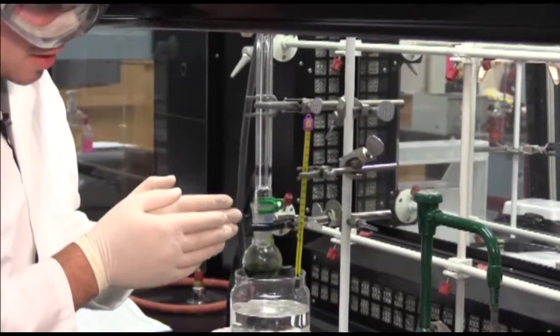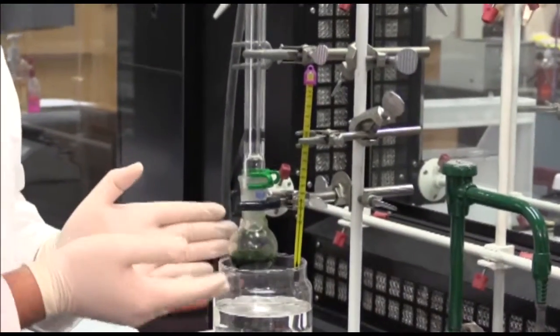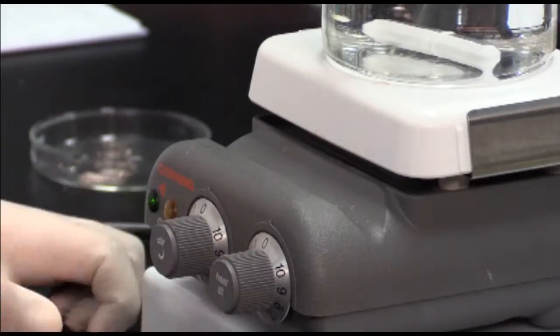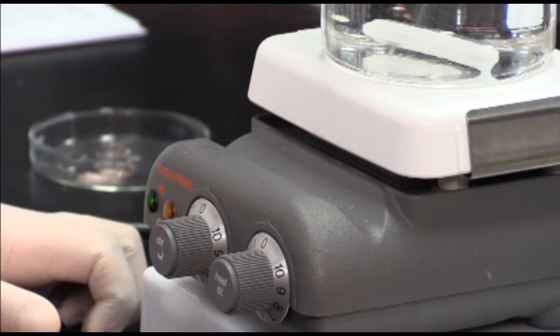Once the condenser, round bottom flask, and thermometer are out of the oil bath, you want to let it sit so it can cool down. At this point, everything has now cooled.